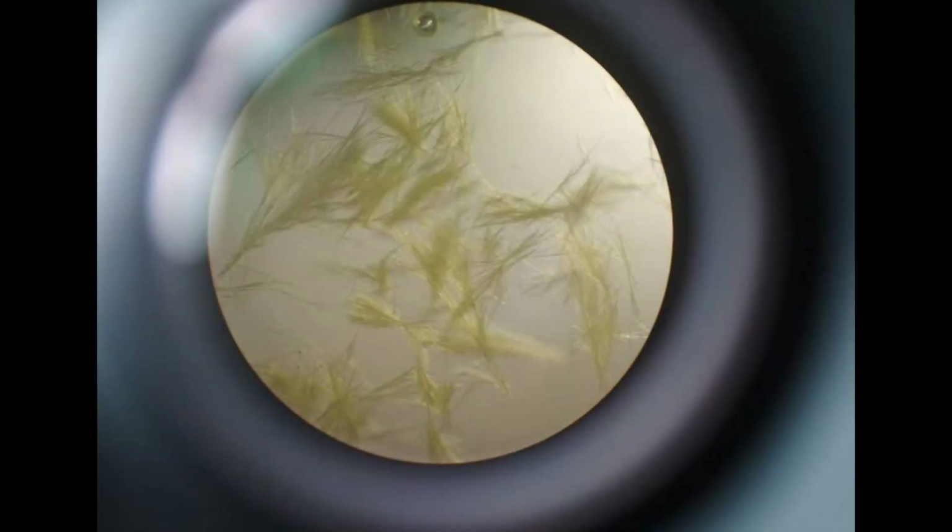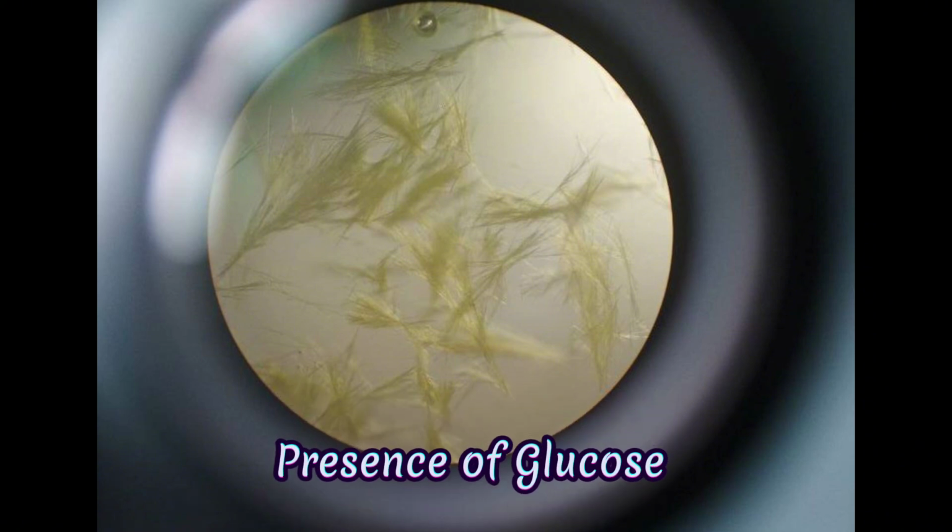Observation: broomstick shaped yellow crystals are obtained. Inference: presence of glucose.